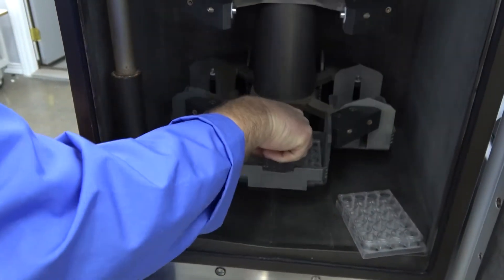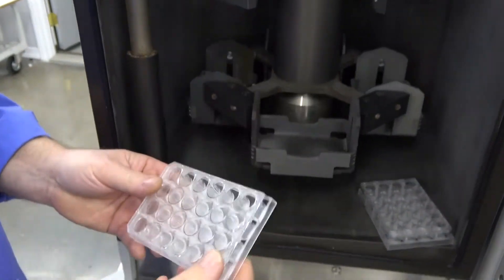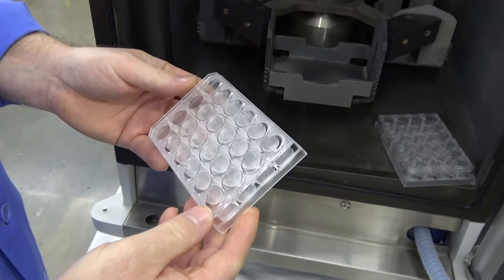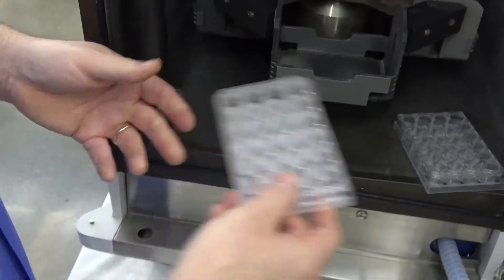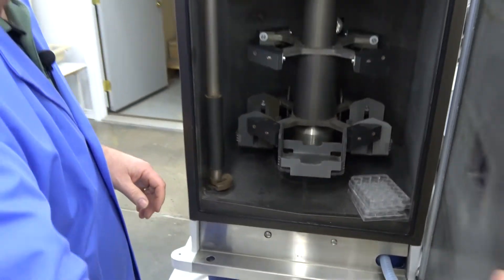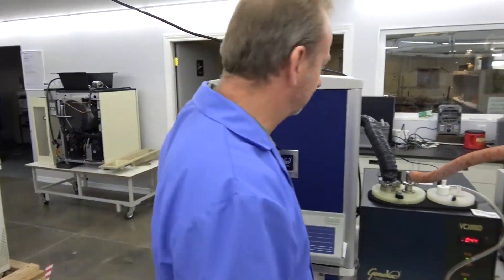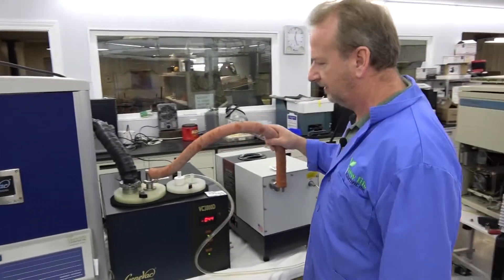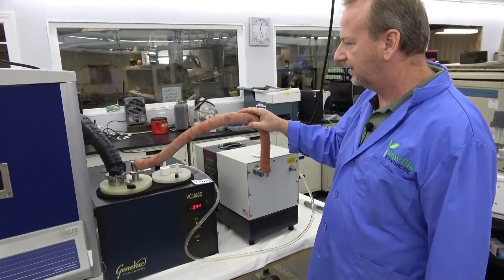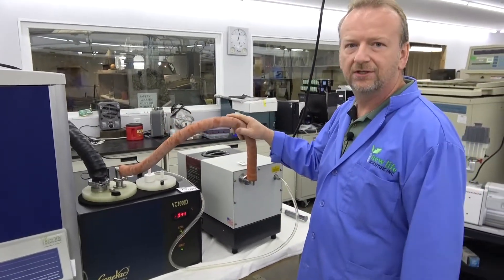So look at the other one. Same thing. So everything's been evaporated really nice. Everything's completely dry. But it seems to be working great. I'll do a purge on it here in a little bit. But I think you'll be well satisfied with it.